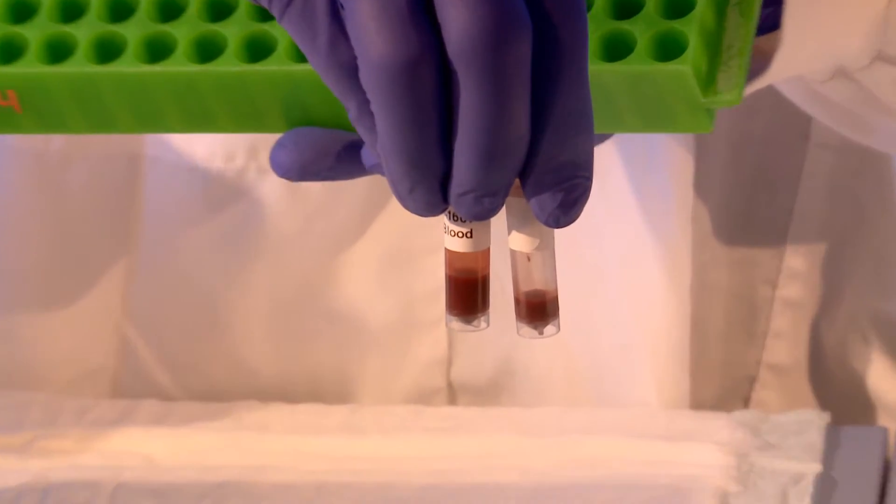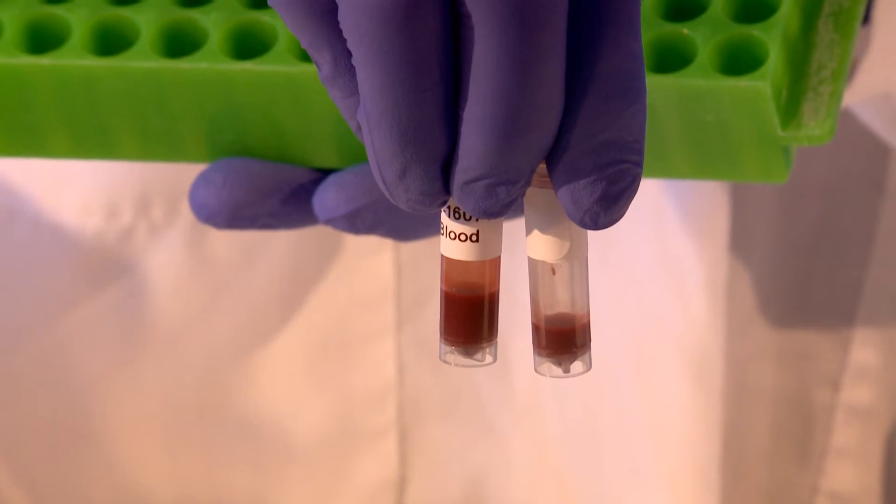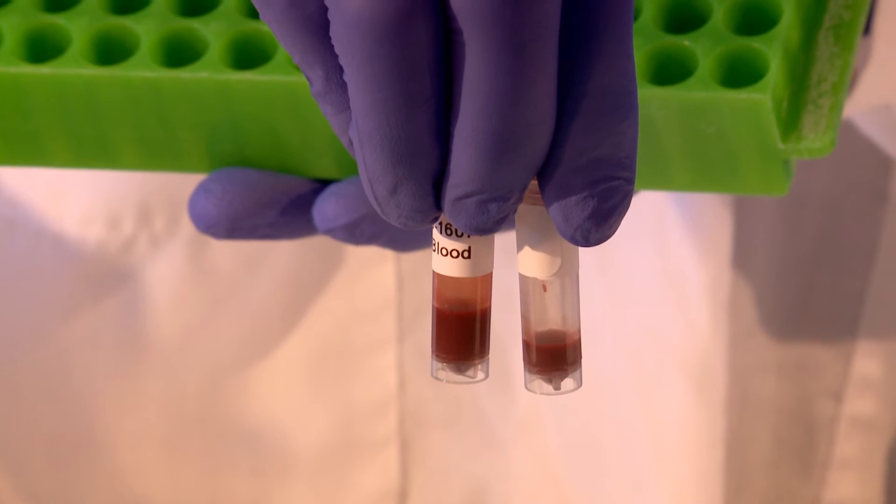In this case we are using EDTA treated whole blood. We will extract DNA from this sample which will be later employed with the PC-RUN Molecular Detection Kit.